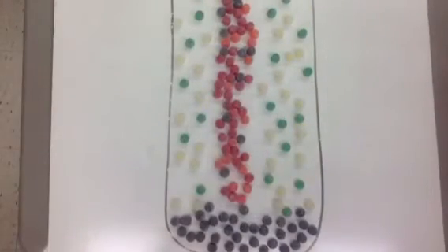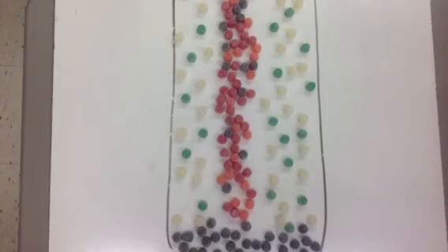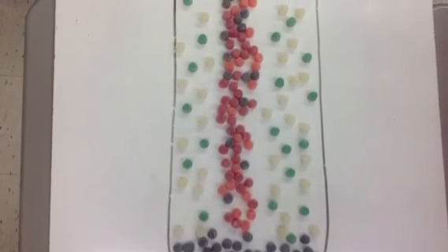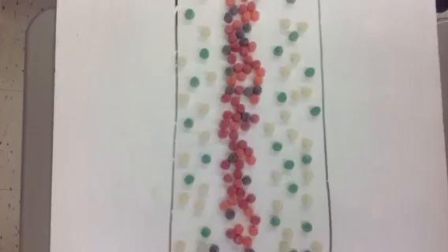Now there are no more silver ions in the solution, meaning the silver ions limit the reaction and the reaction is complete. There's plenty of silver piled up on the bottom of the test tube, and a few silver atoms that are still stuck to the wire. Some copper wire has not reacted yet, and won't because there are no more silver ions to react with, and there are lots of copper ions in the solution.